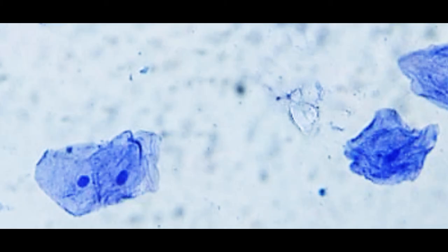It's also very common to see cells that are stacked or clumped together because, well, that's what cells do. They kind of clump together to form a tissue. But very often you can see one or two whole cheek cells that look beautiful, and you are able to see a darkly stained nucleus and its cell membrane.